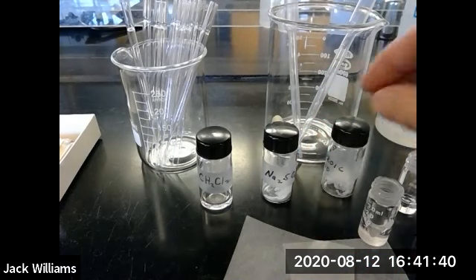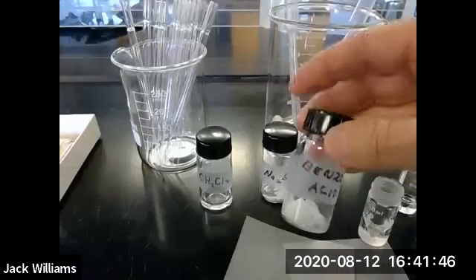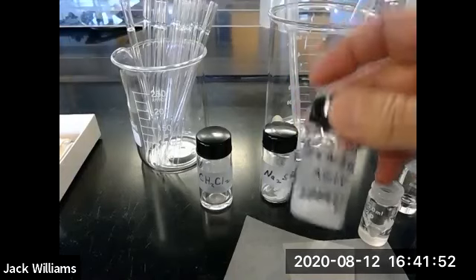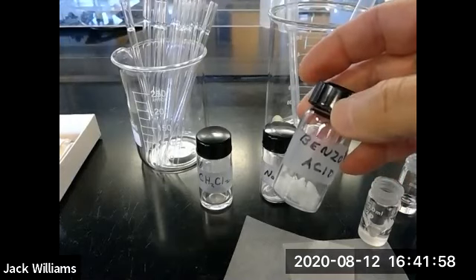Okay, so we're going to weigh out a certain amount of benzoic acid. I think the experiment calls for 0.4, is it, don't quote me on this, 0.4 millimoles. We're going to use millimoles in the organic lab most of the time. And that's because we're only dealing in milligrams.